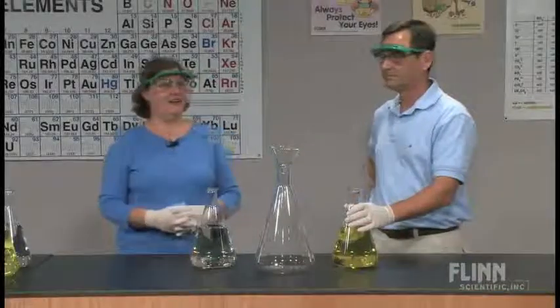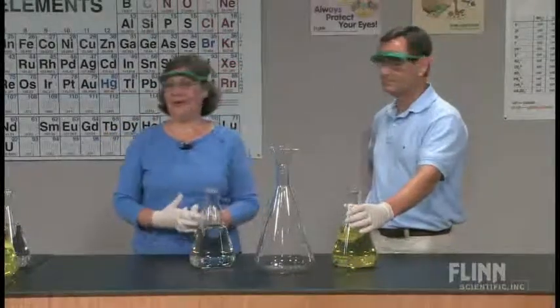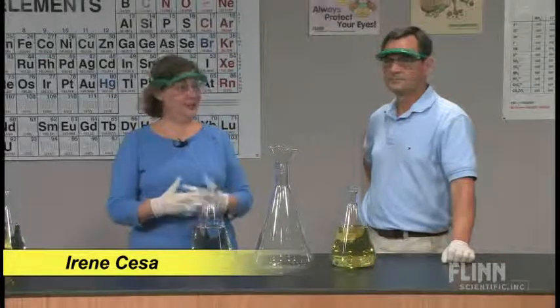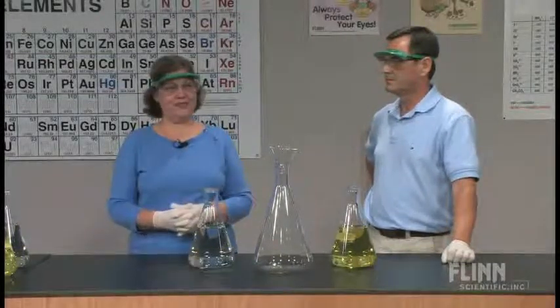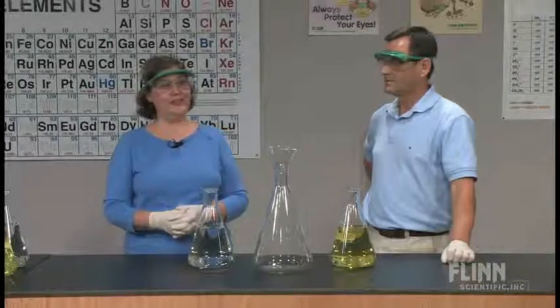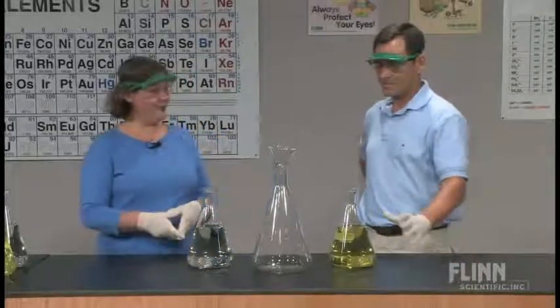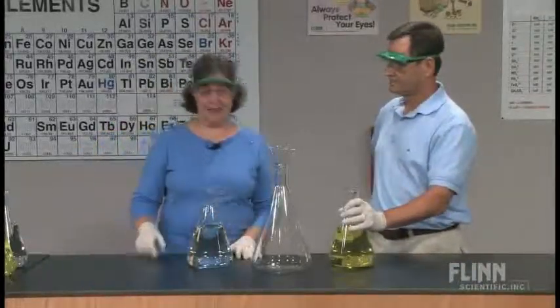You can see a wire glow or a candle burn. Light and heat are often produced together in chemical reactions. Can you produce light without heat? Yes you can, and we call it cool light. So we're going to do the cool light demonstration on a large scale.